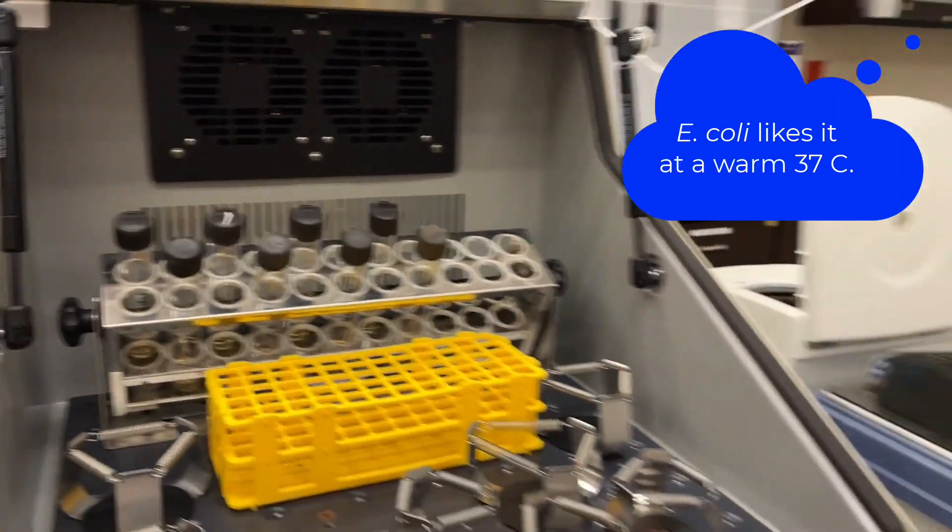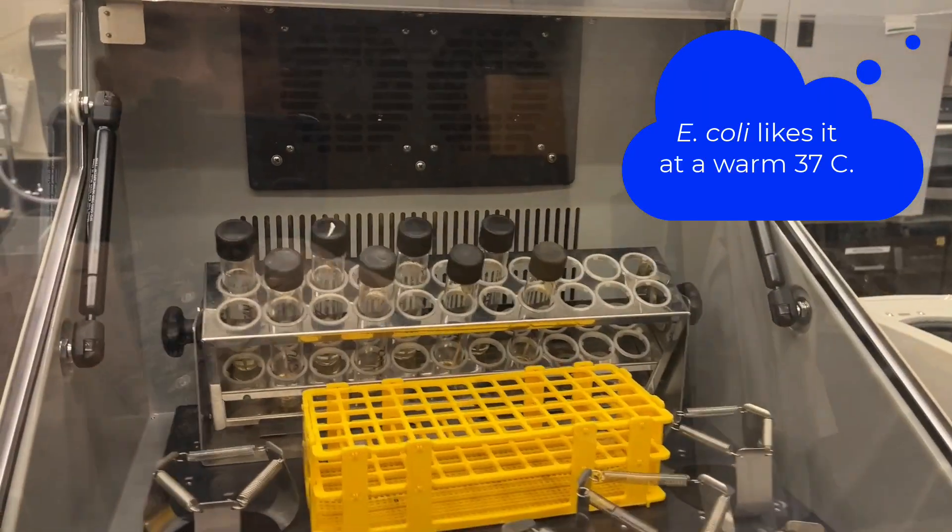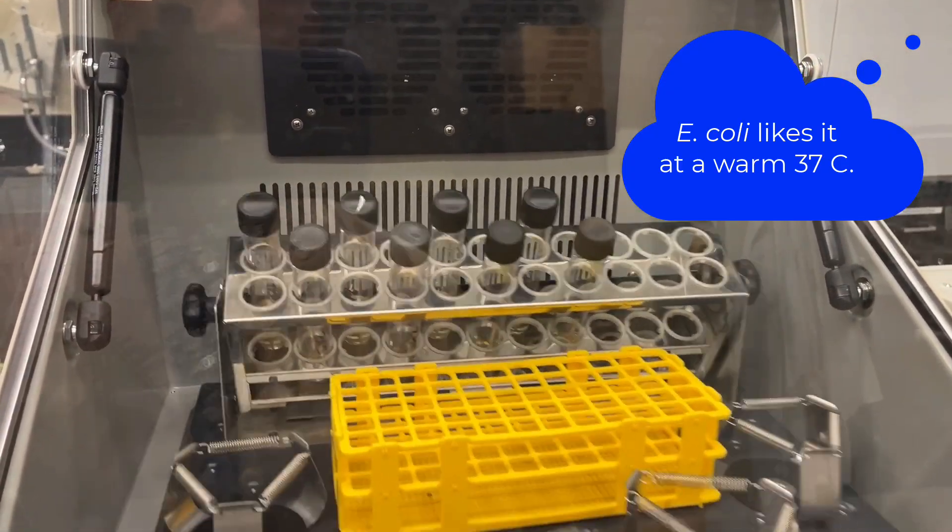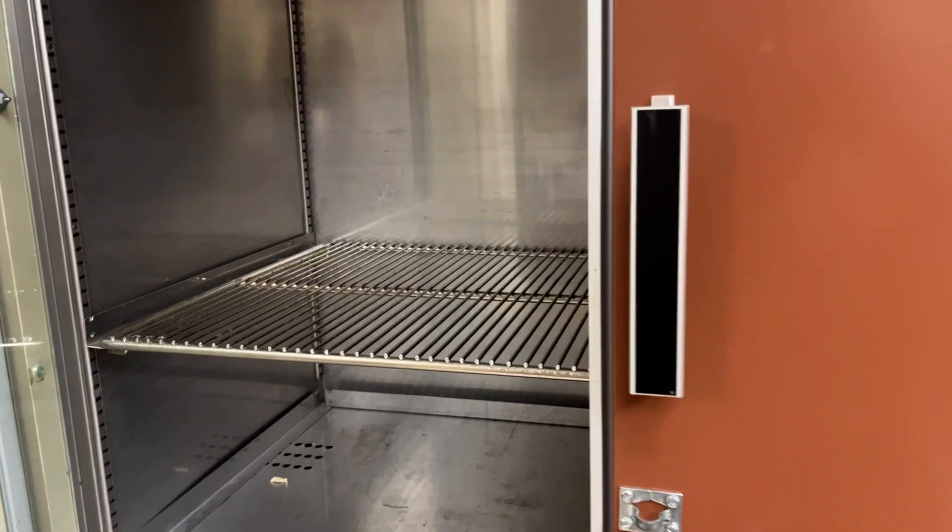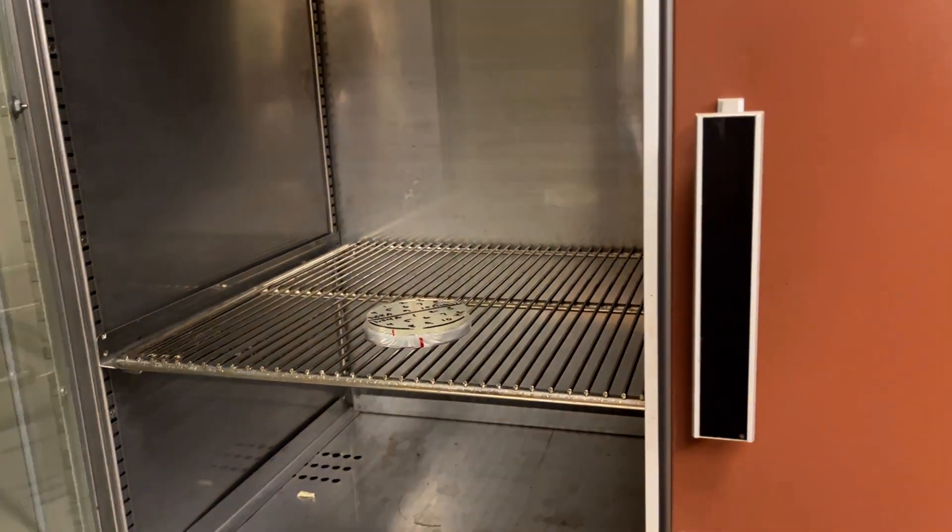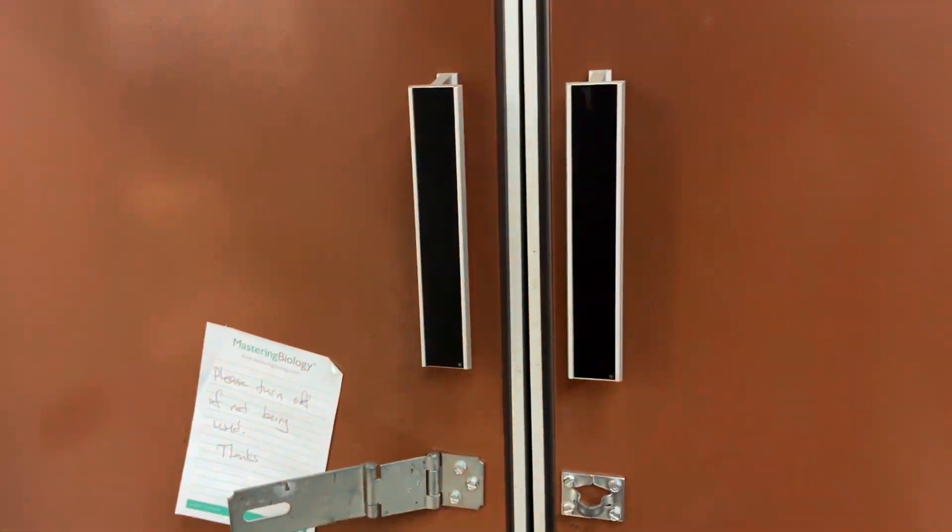Simply close it and just make sure that it's shaking. If it's shaking we're all good to go. And the plate goes into the incubator, also set at 37. Be sure that it's turned on, and we'll see all of these tomorrow.